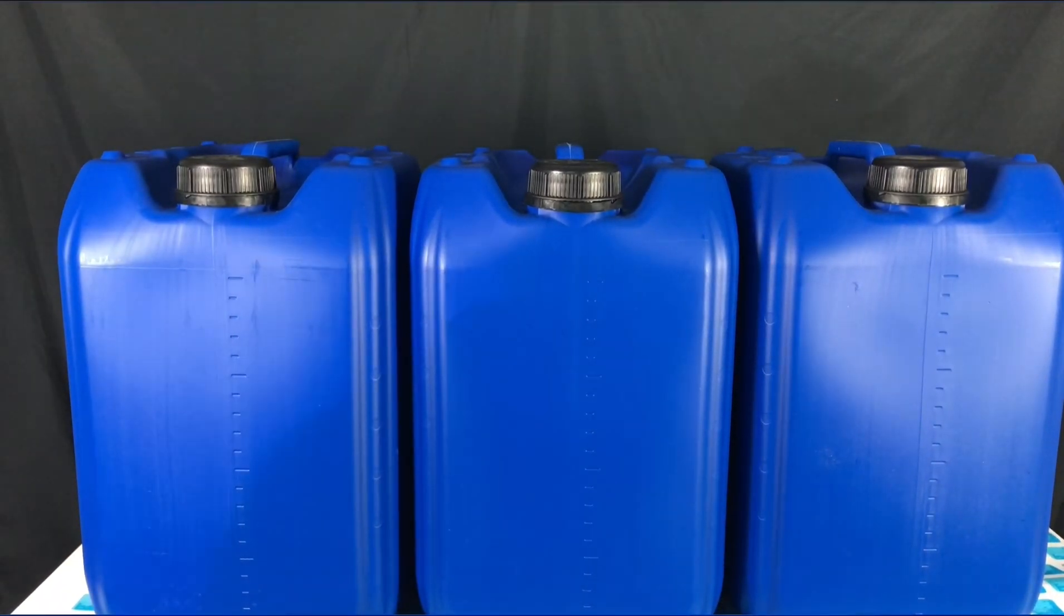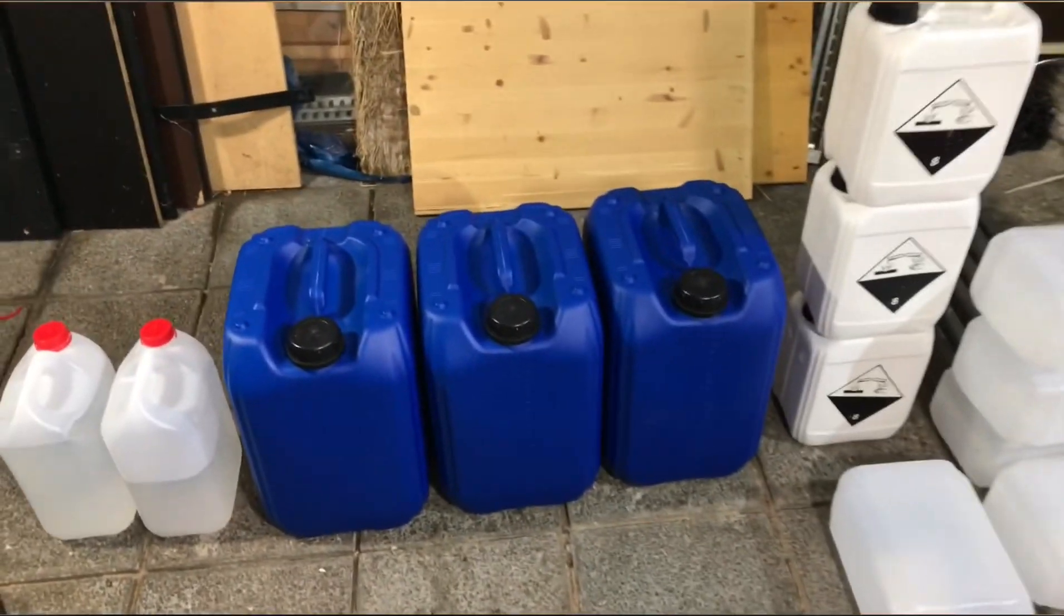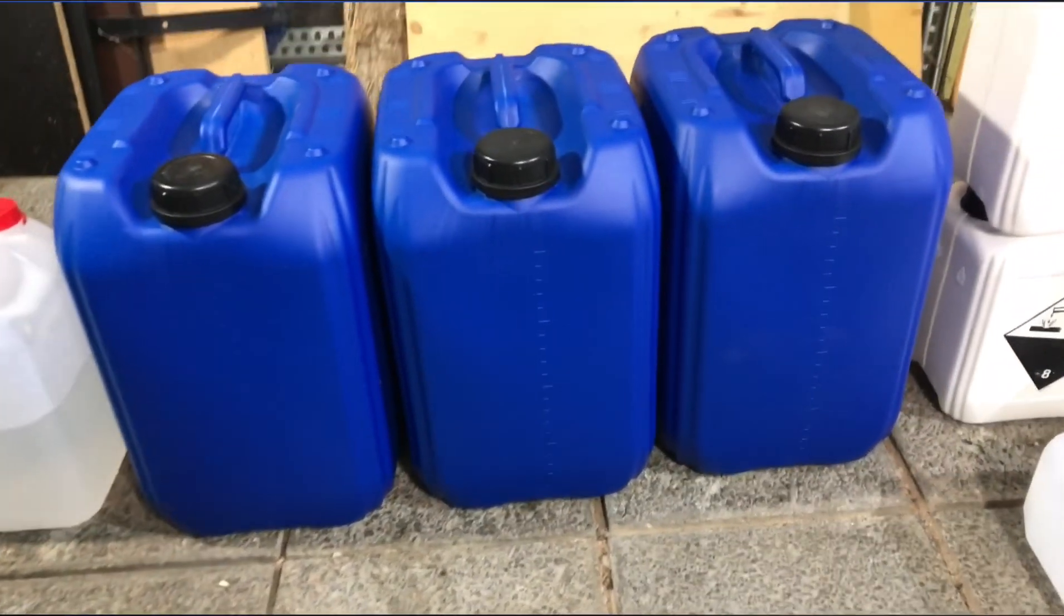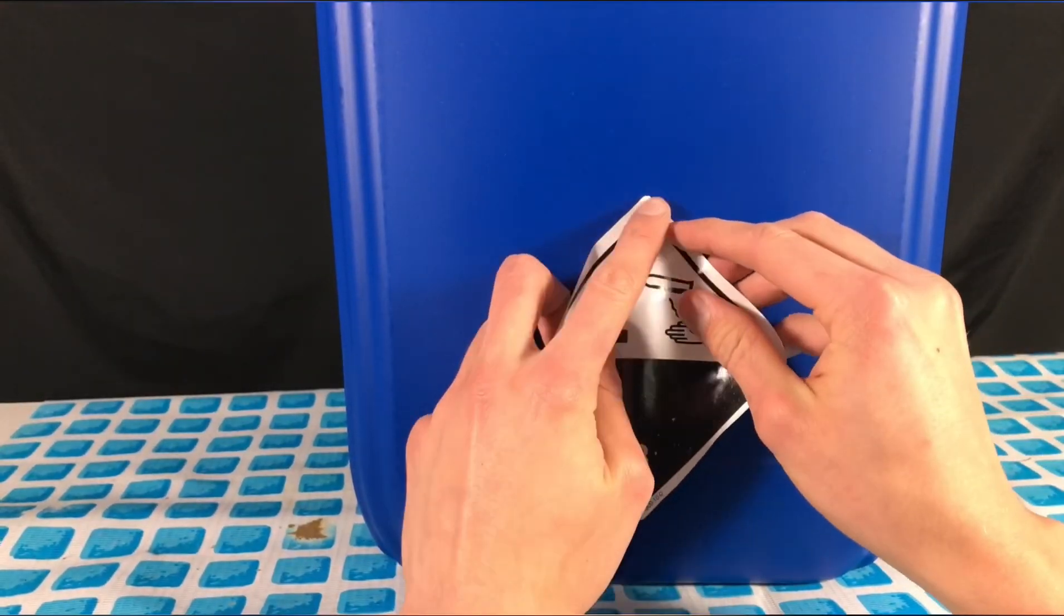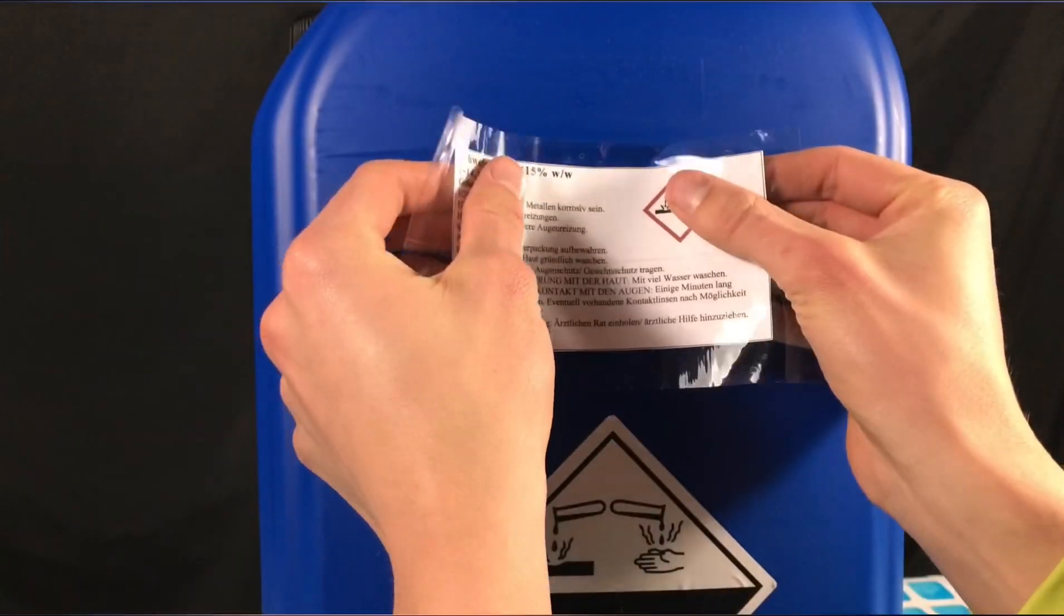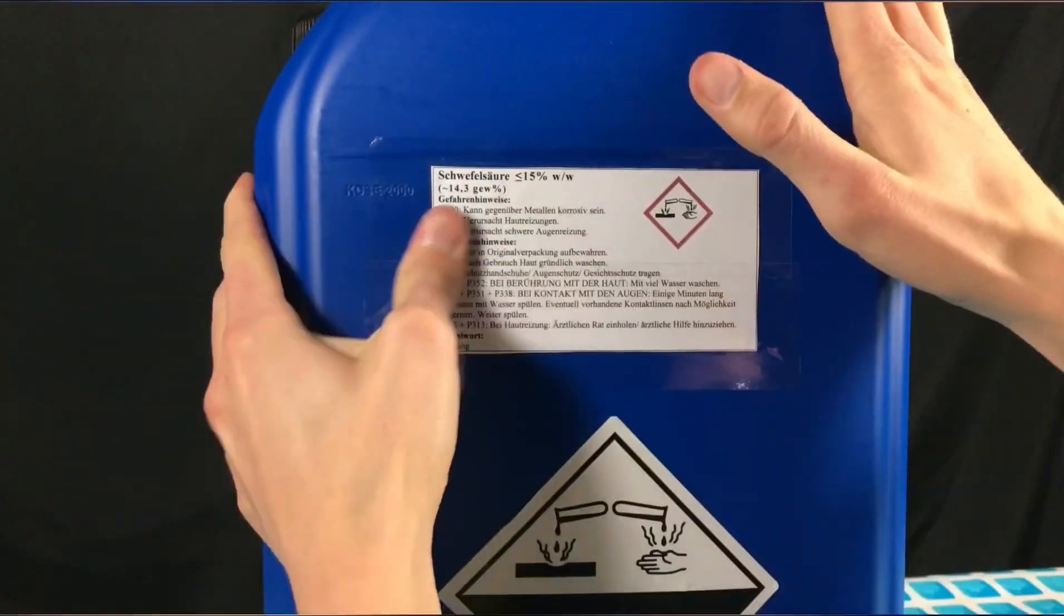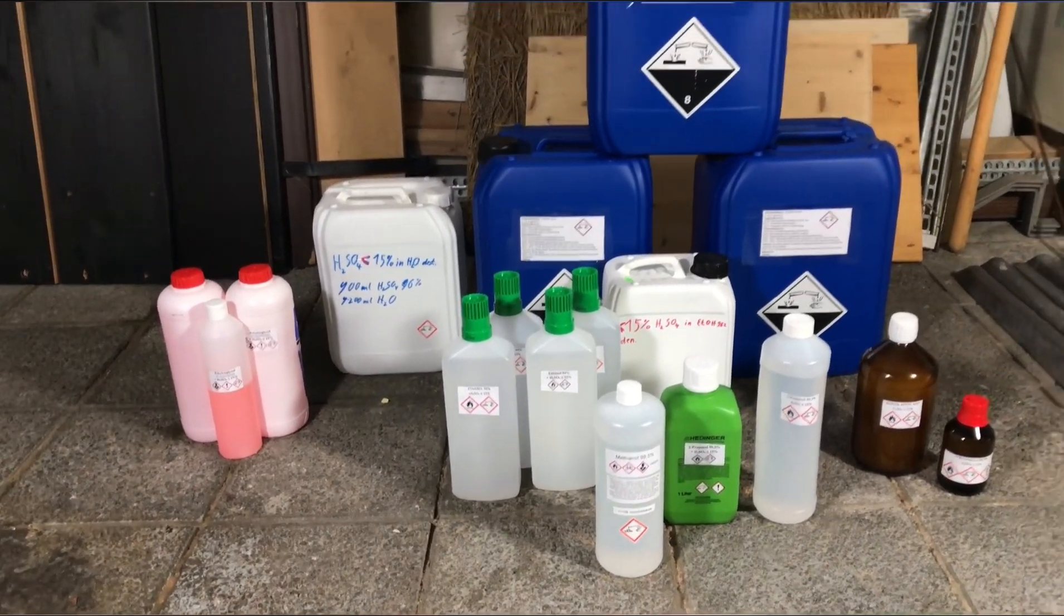This is what we were left with in the end: a lot of empty canisters, some leftover distilled water, and a lot of dilute sulfuric acid. There's one thing left to do, which was label the canisters appropriately.